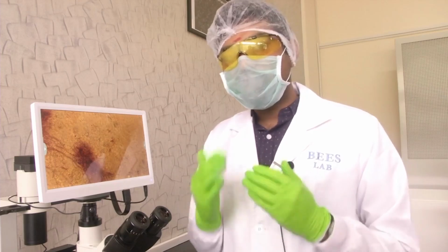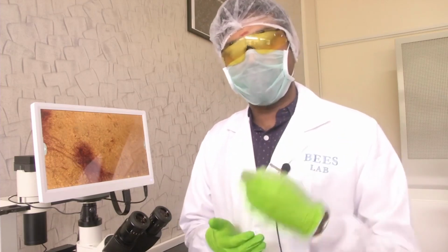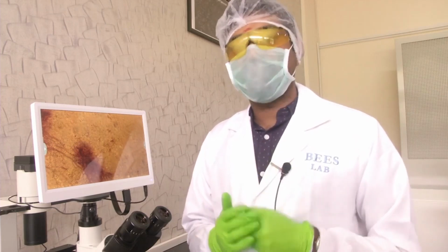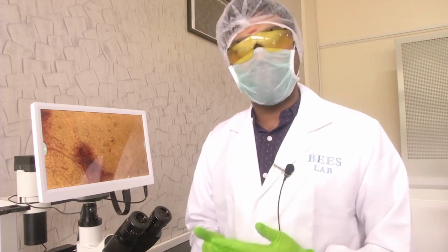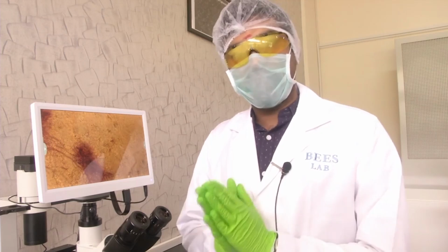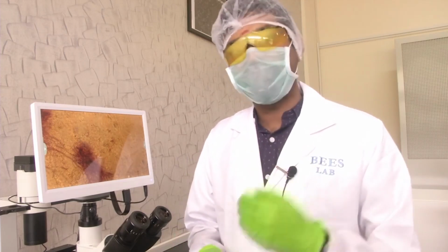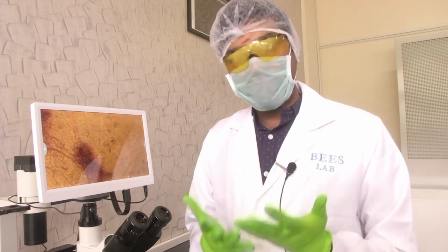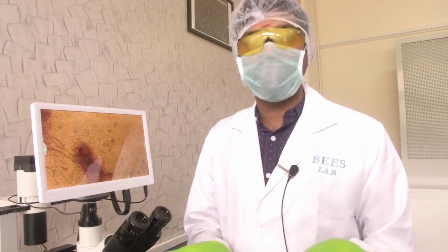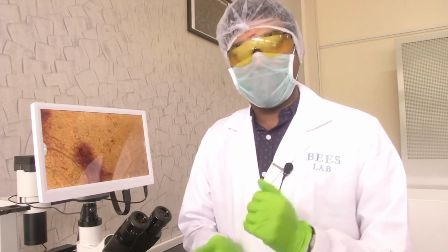Now, what is the utility of an inverted microscope? If you look into the literature, or if you talk to people working in the research field, they will immediately tell you that the inverted microscope is used for biological applications. They are primarily used in a biology lab or a lab that works in the interface of medicine and engineering to look at live cells, tissues, dead tissues, growing cell cultures, and various other scenarios. Why is the main question.